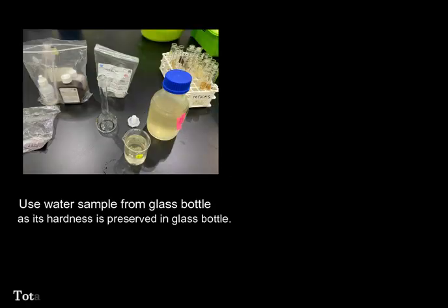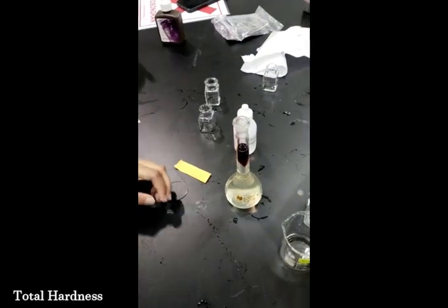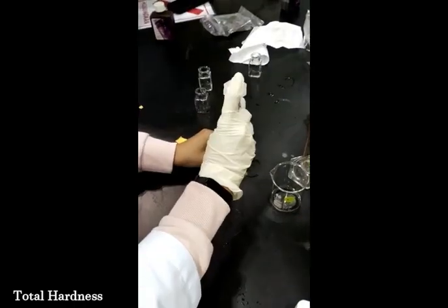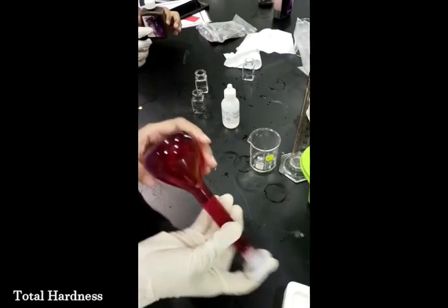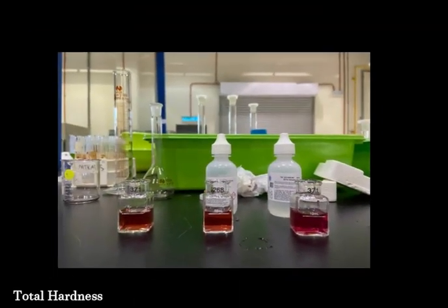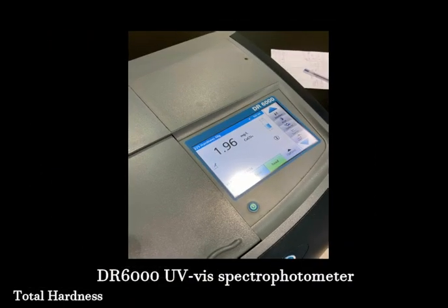Initially, the total hardness test was conducted. The sample was poured into a 100 ml graduated mixing cylinder. The mixing cylinder was inverted several times to mix before 1.0 ml of alkali solution was added. 10 ml of the solution was poured into each of 3 sample cells. Push read to read the result in the DR6000 UV-Vis spectrophotometer.